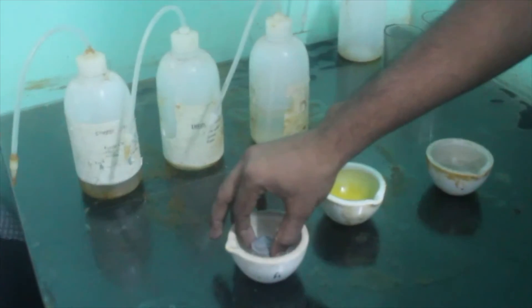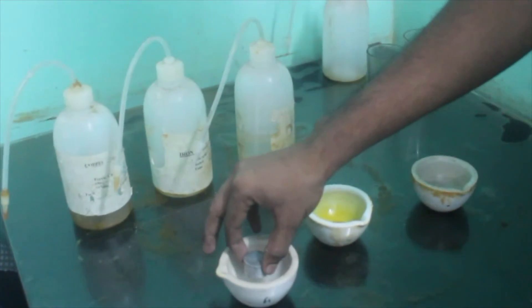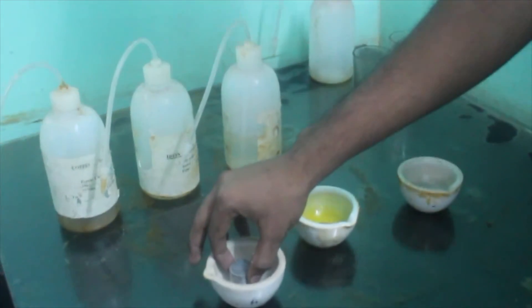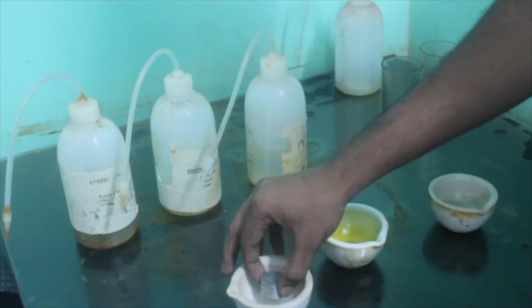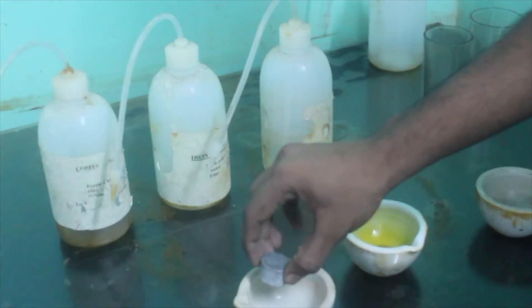This etching process is generally used to make the grain size more visible when using a microscope. We will use the microscope to examine the grain size structure.